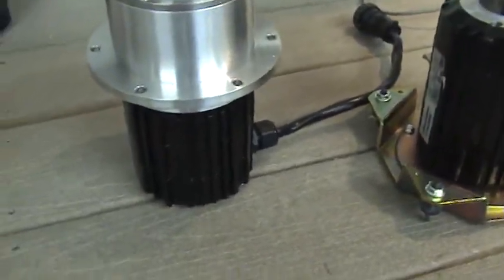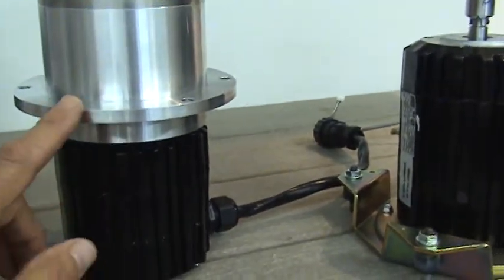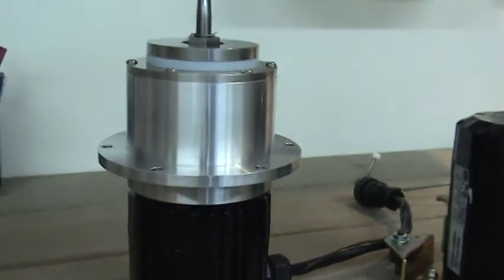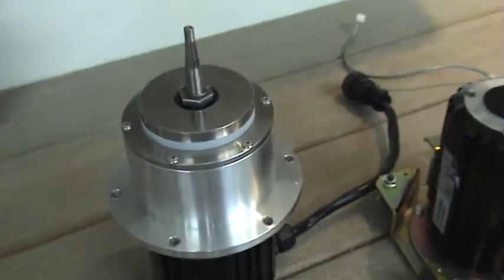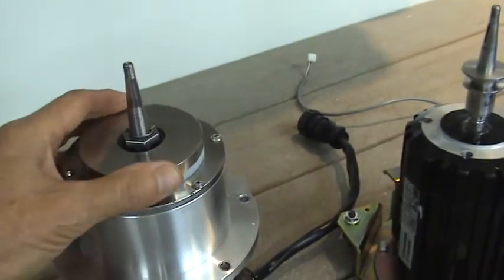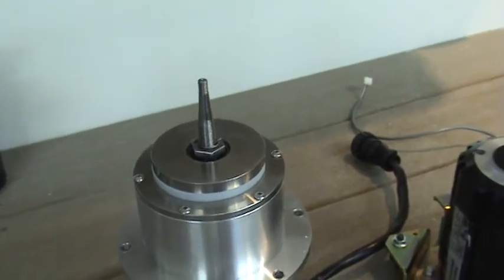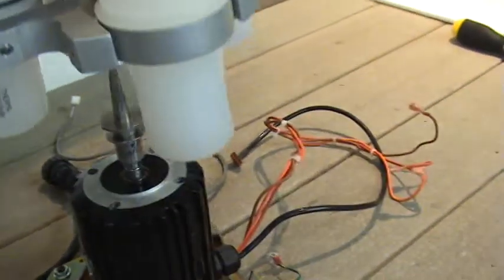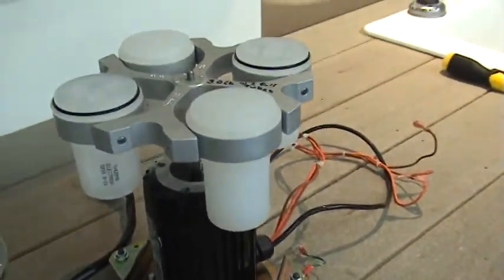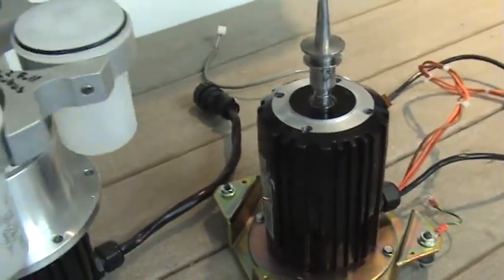This unit called Rotor-Mate is quite different in that the motor is mounted hard to this aluminum housing. The housing is mounted rigidly to the chassis, but the flexing of the rotor is allowed by means of the mechanism inside, and this allows for what we call mass centering. And you can see that the same rotor mounts on these two assemblies in exactly the same way, and we'll be showing that in just a second.